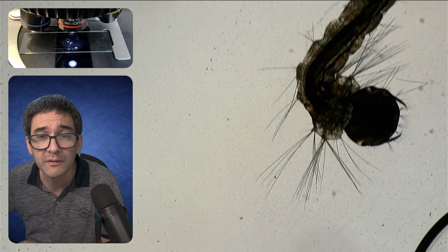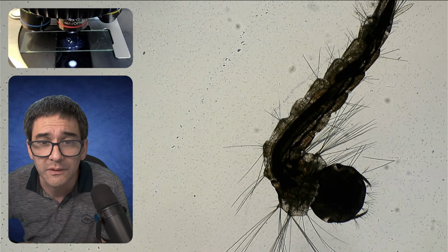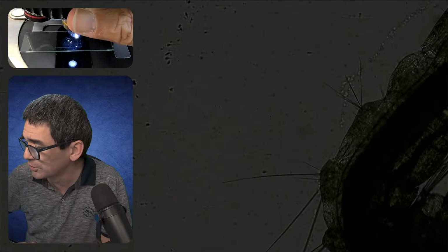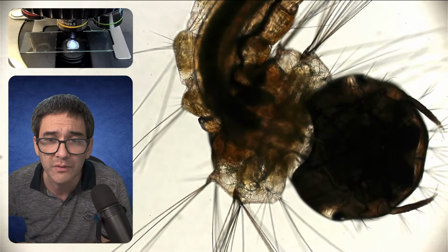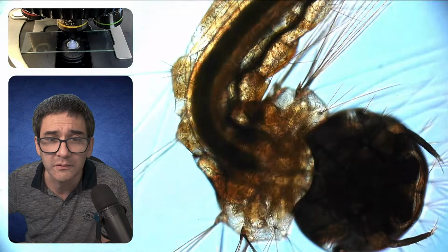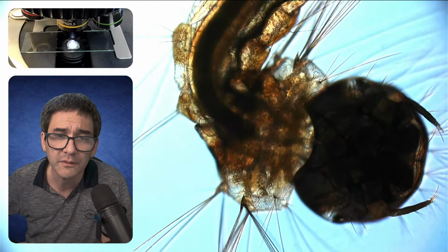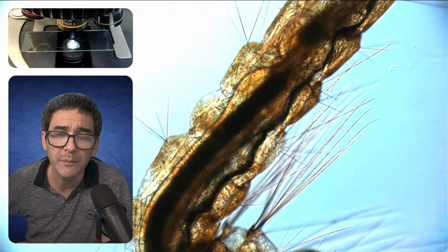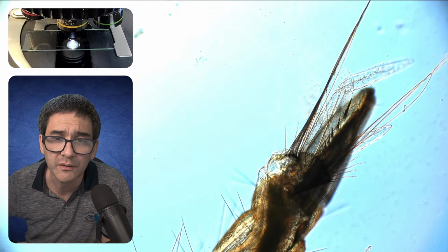Here it is. So much better. And then we should also be able to actually look a little bit into the digestive system. Let's add a little bit of color. And over here in the back, this is the breathing organ here.